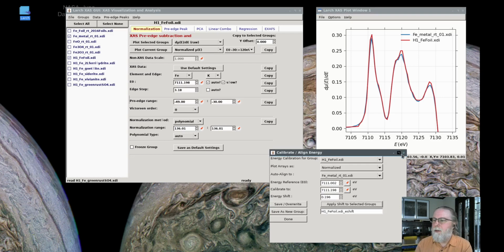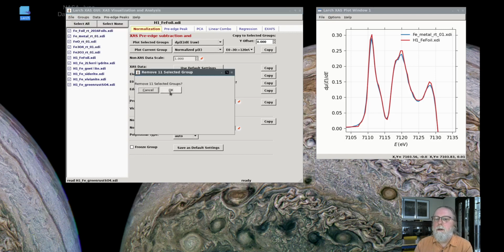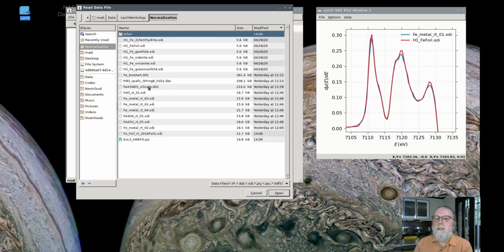It's not uncommon for the energy calibrations to be different by more than this range, but 0.2 eV at the iron edge can be a significant shift in energy if you're trying to calibrate and do XANES analysis, as we'll get to in a few videos. So for now, I'm going to get rid of all of these spectra and go on to the remove selected groups, just get rid of all of those, and go on to the next, and the next most important form of data correction, and that is to remove glitches from data.